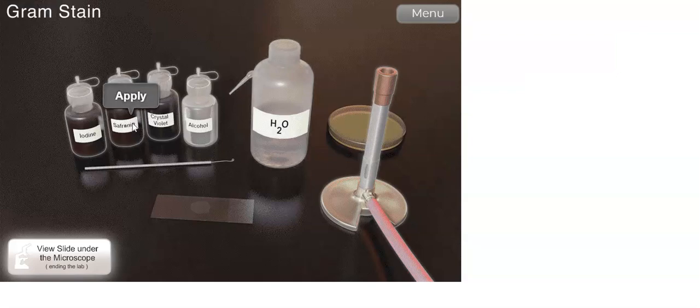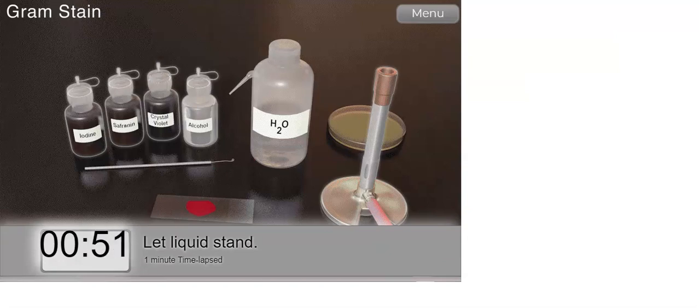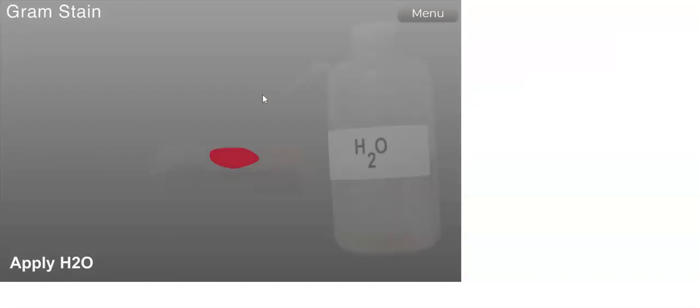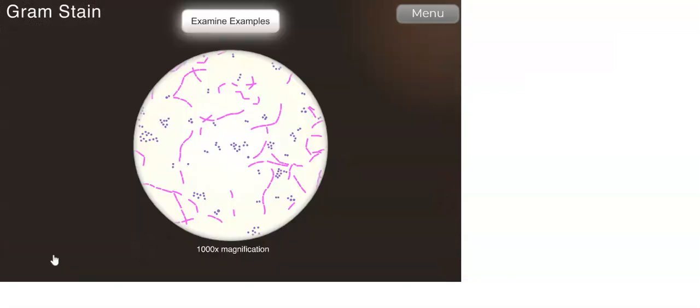So the last staining solution is safranin. Safranin is used as a counterstain in gram staining. In gram staining, safranin directly stains the bacteria that have been decolorized. Then we rinse off the excess safranin using distilled water. With safranin, the gram-negative bacteria can be easily distinguished from the gram-positive bacteria. So we are going to view the sample under a microscope.